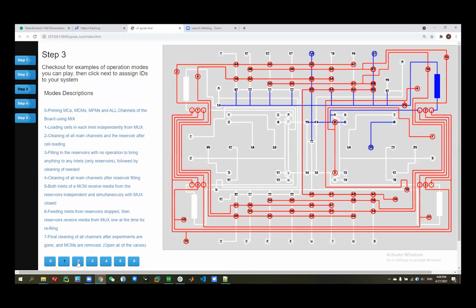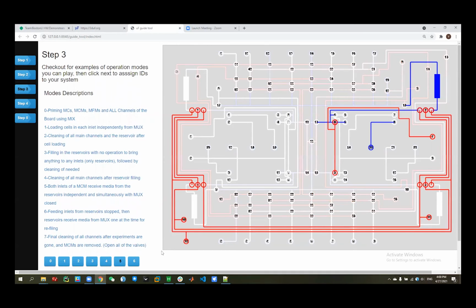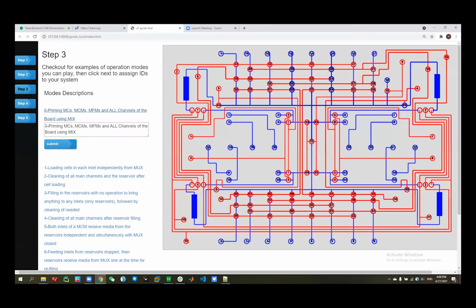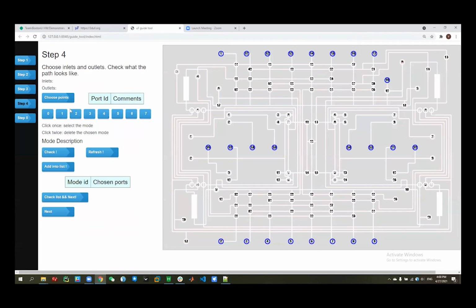So now we can see what it looks like, and the simulation pathways for different modes have different pathways. So we can see here, and we can also change the descriptions here, because maybe some of the users don't think our descriptions satisfy their target. So we can just type a string here, and it will be changed. Now we go to the step 4.